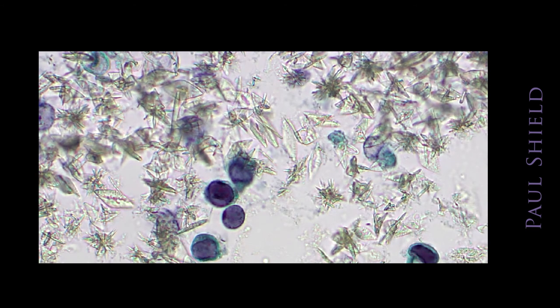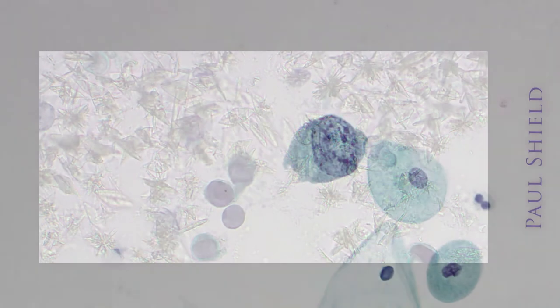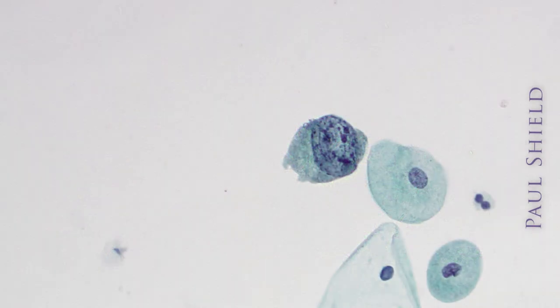So these are known as decoy cells also because they can mimic high-grade urothelial carcinoma cells. They have a very high NC ratio. In addition to that glassy appearance to the nucleus, polyoma virus infected cells sometimes have what's called ropey chromatin, which looks like this, and it again is a degenerating change.